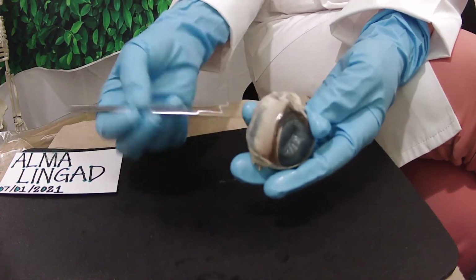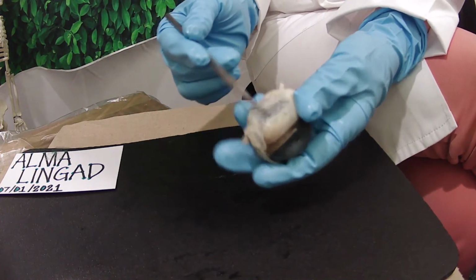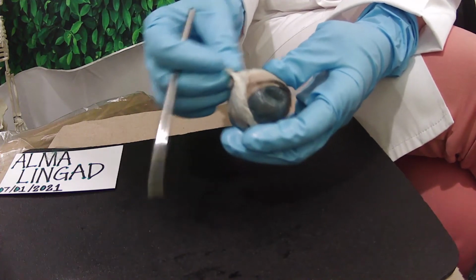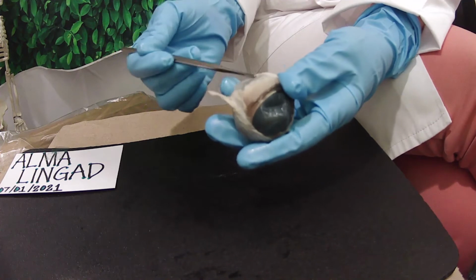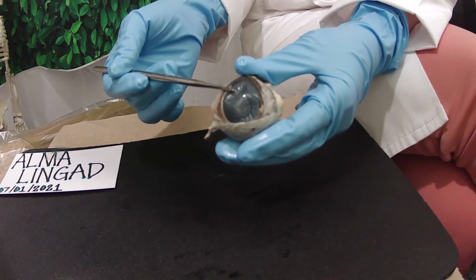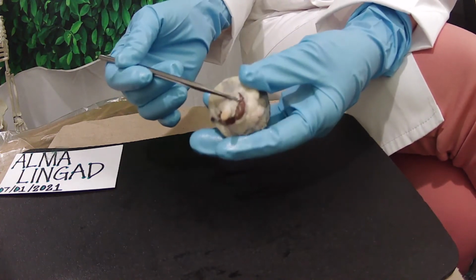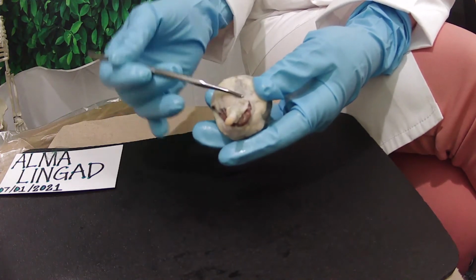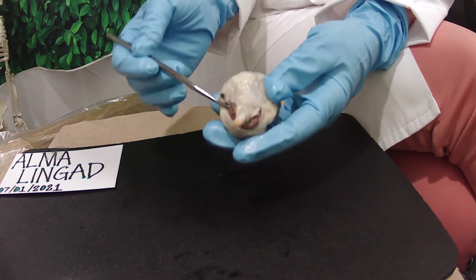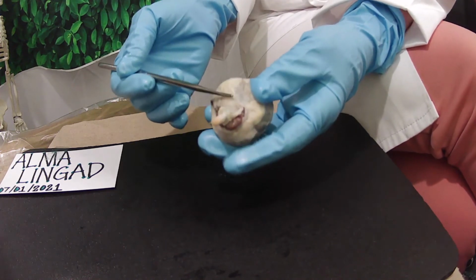After cutting away most of the fat and muscle tissue around the eye, this is how it looks. So this white outer layer of the eyeball is called the sclera. It is a tough, protective covering, and the muscles that control the eye movement are connected to it. And this part is the cornea. It is the clear outer layer at the front of the eye. It helps your eye to focus light so you can see clearly. And at the back, or the posterior side of the eye, is the optic nerve, which we have seen in the beginning. As I said, it is also called the second cranial nerve. Its job is to transfer visual information from the retina to the vision centers of the brain via electrical impulses.